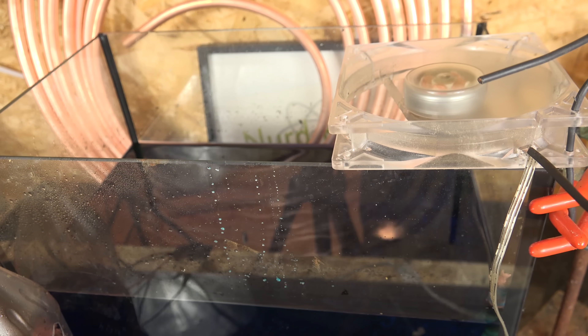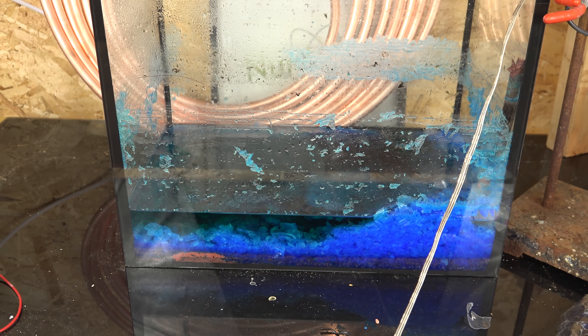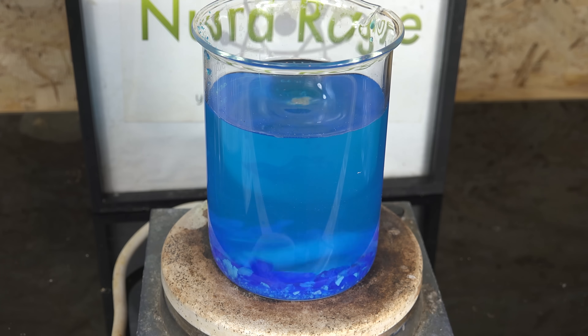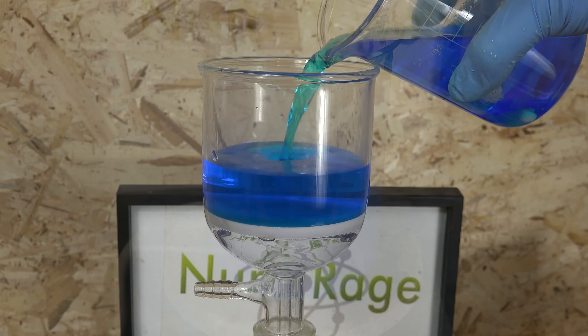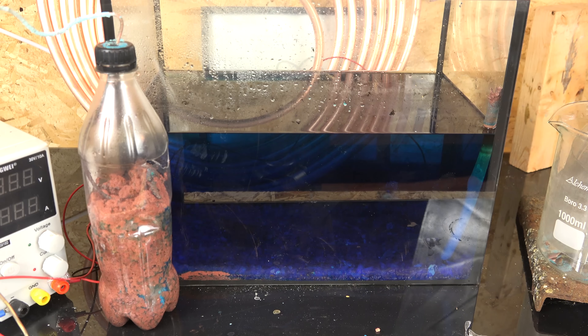We still produced a lot of copper sulfate crystals that you can see here already crystallizing out. I'm going to let this evaporate to crystallize more copper sulfate, and to speed that up I'm blowing air over the surface using a computer fan. A couple of days later here is our copper sulfate — it's not very pure but I can recrystallize it. To do that you'd quickly wash off the acid, dissolve the crystals in water, filter out insoluble materials, and pour it out to evaporate again. I'm not going to bother since I'll be using this in a refining cell that will get contaminated anyway.